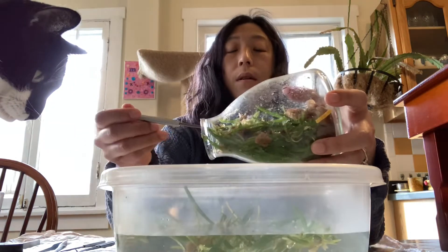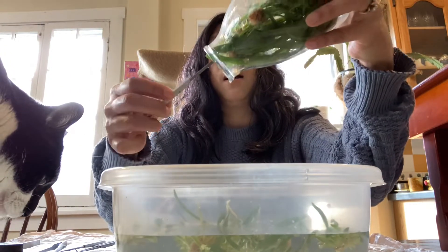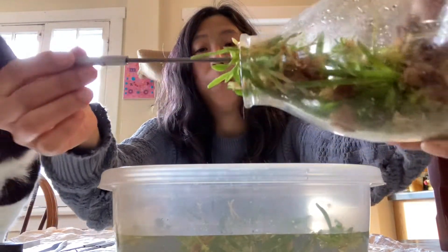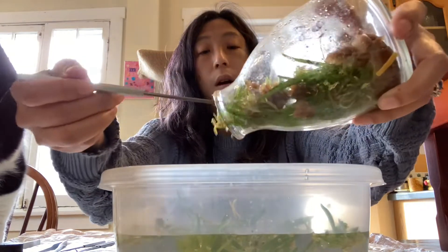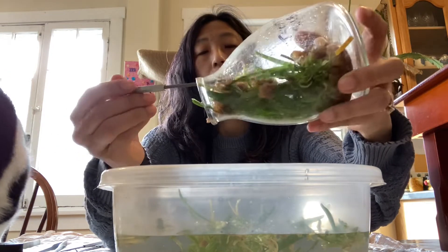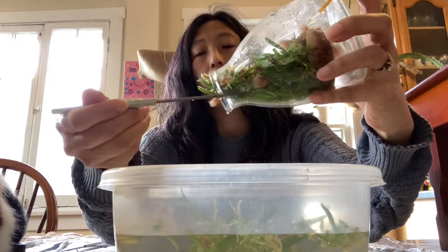I can sit down now. Come, little plants. I'm just teasing them out with the hook like this. There it goes. So many little plants. This wasn't that hard — I had to smash the glass last time. And who knows what shape they're coming out in, but hey, they're coming right out.